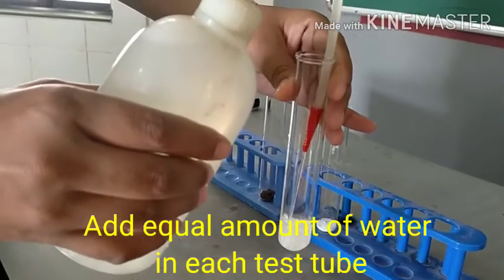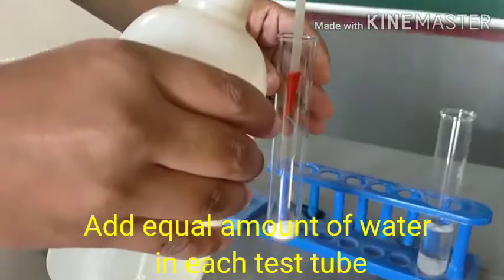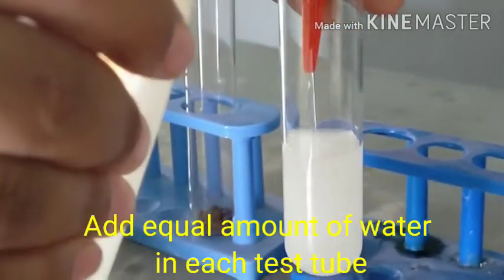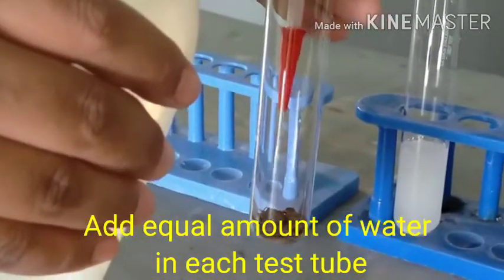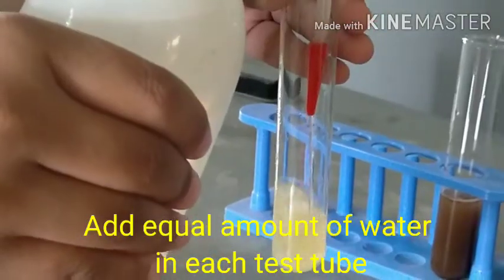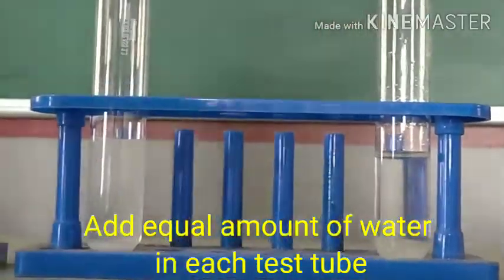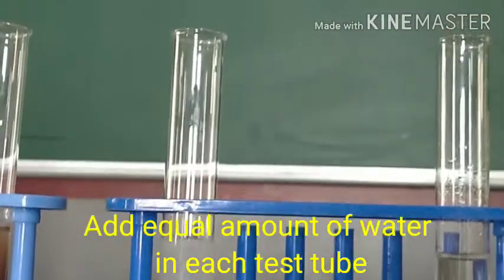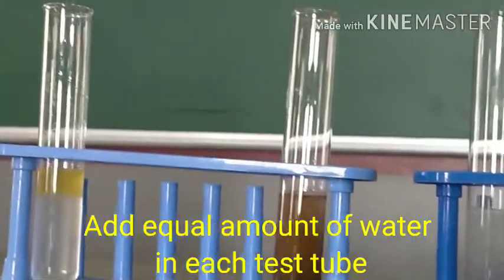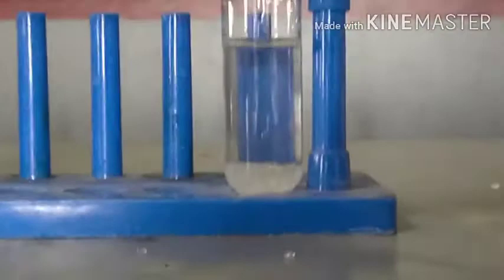This is a water bottle to add water into each test tube. Now children, we need to add an equal amount of water into each test tube as shown here. Observe it very carefully. After adding equal amounts of water into each test tube, keep the mixture as it is on the stand.